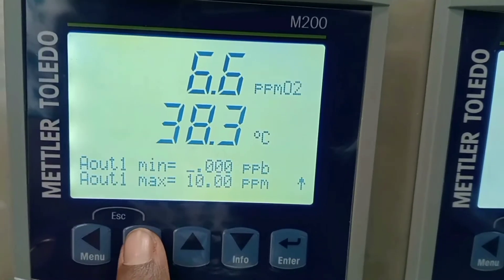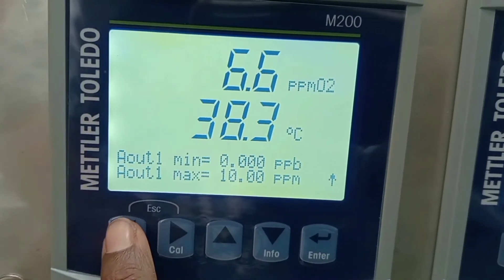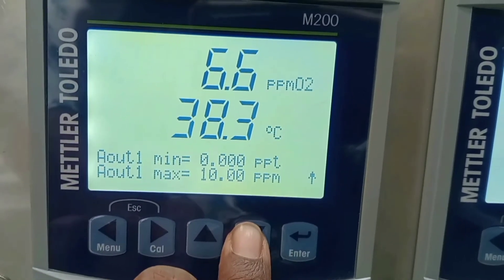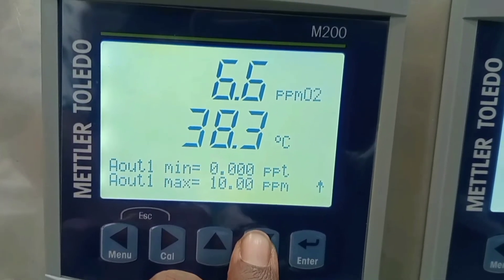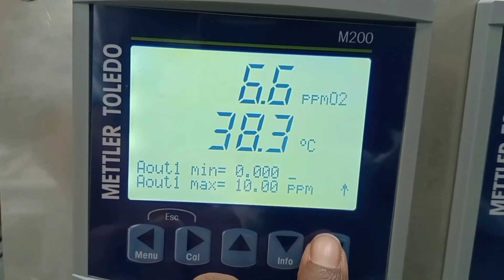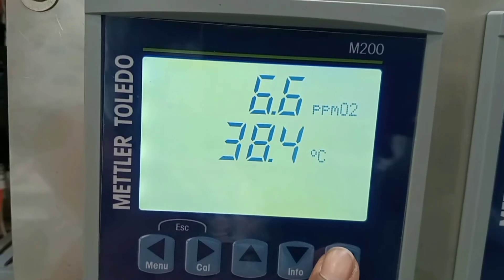On this screen you can see analog out one min and analog out one max range. This range is user-settable, so you have to set the measurement range as per your requirement. There are various options available: you can set the readings in ppm, ppb, ppt, or percentage air. I am selecting ppm, then enter and save the changes.